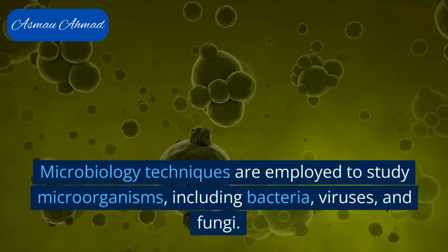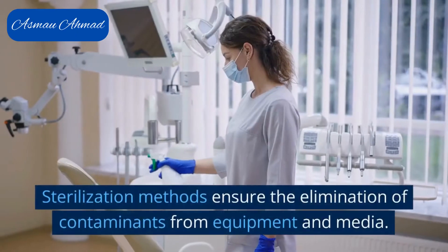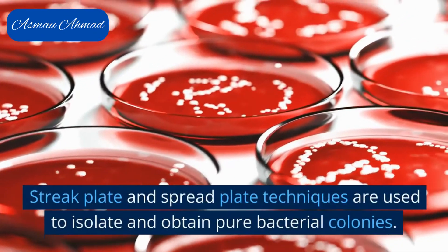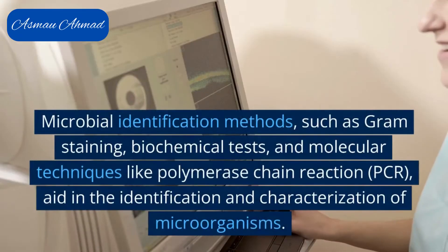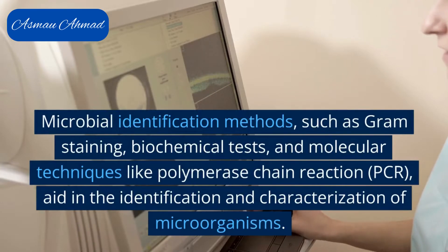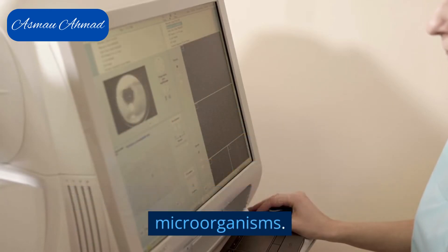Microbiology techniques are employed to study microorganisms, including bacteria, viruses, and fungi. Sterilization methods ensure the elimination of contaminants from equipment and media. Streak plate and spread plate techniques are used to isolate and obtain pure bacterial colonies. Microbial identification methods, such as gram staining, biochemical tests, and molecular techniques like PCR, aid in the identification and characterization of microorganisms.